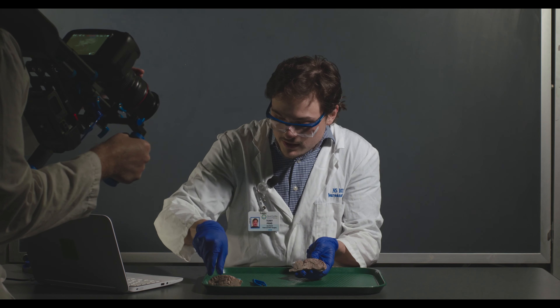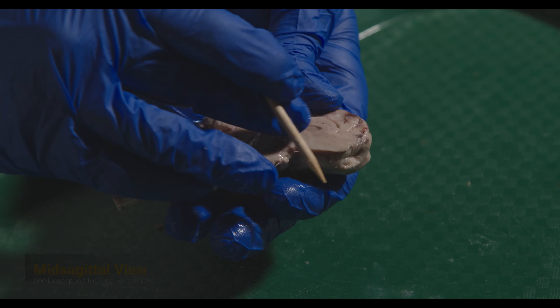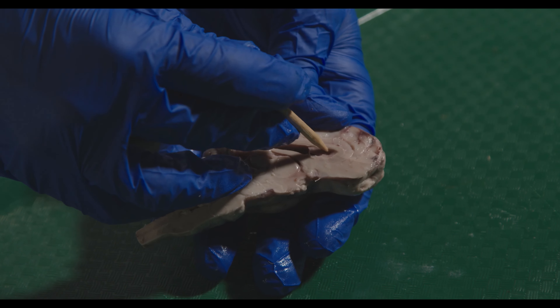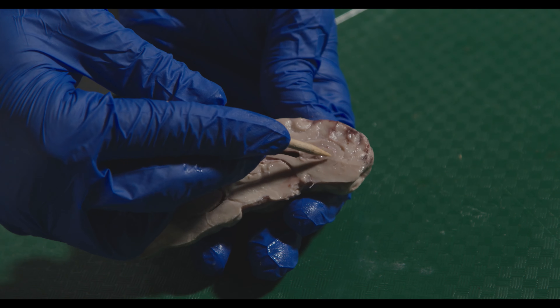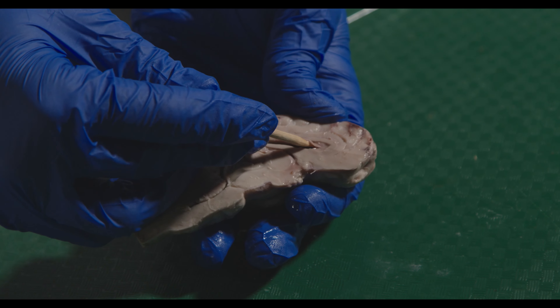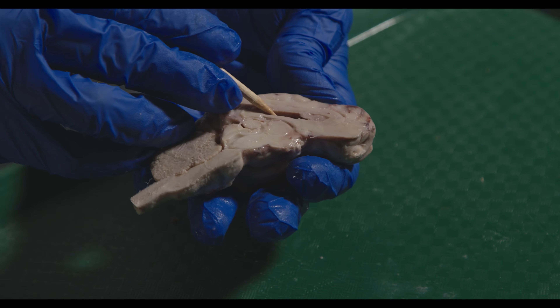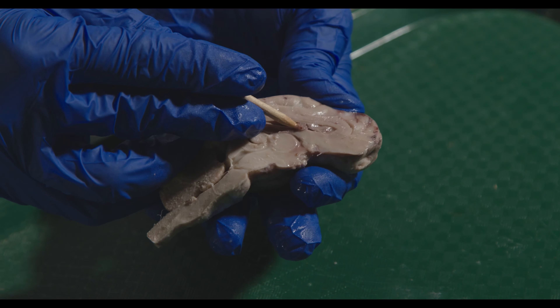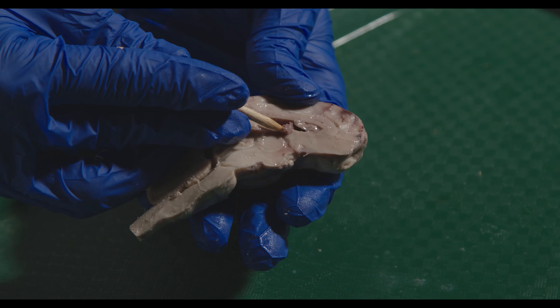You should see something like this. Here you can see the corpus callosum — it's a little hard to differentiate from the cingulate gyrus above it, but these are the white matter tracts connecting the two hemispheres. Just below that is a cavity — that's the lateral ventricle, which houses cerebrospinal fluid. Some of this material in here is choroid plexus, which is essentially involved in producing cerebrospinal fluid — it filters blood plasma to produce CSF in that cavity.